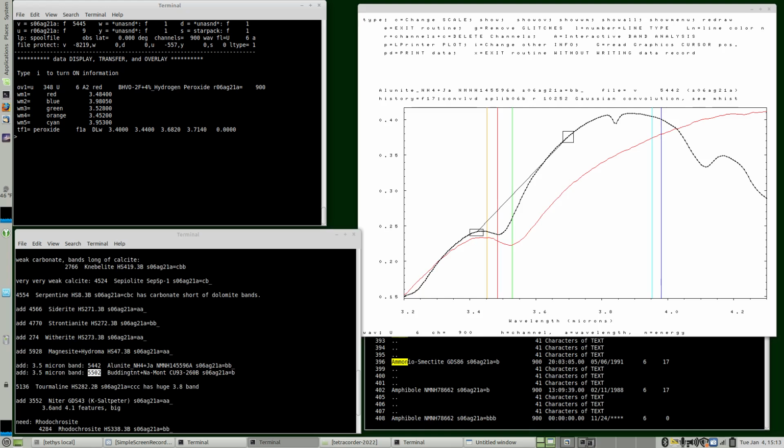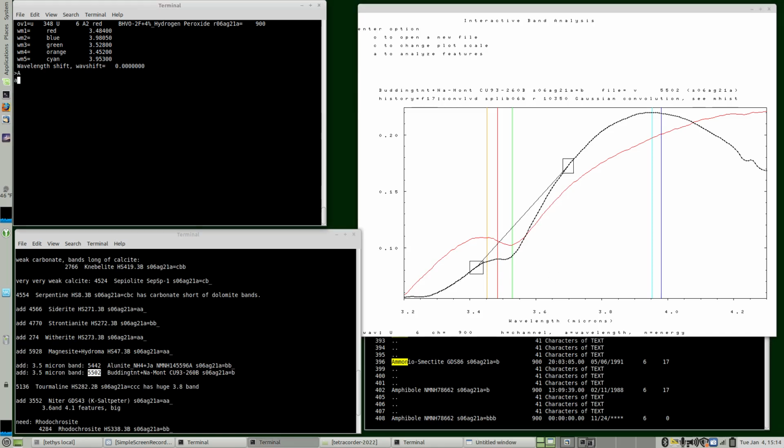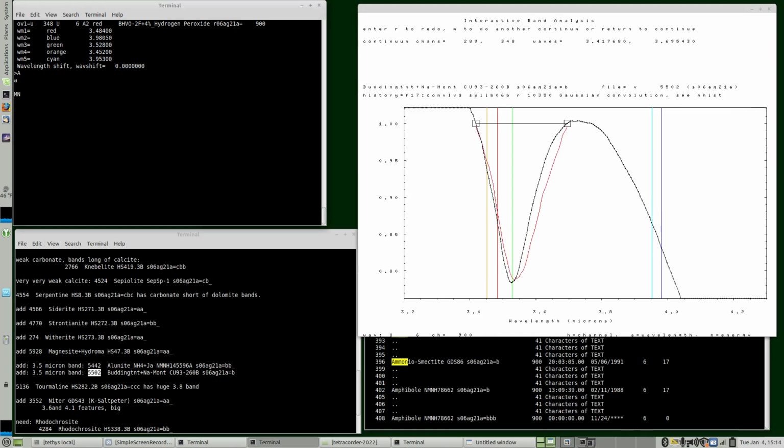And now let's look at this other one. And that has a band that's basically right on. So in a continuum removed feature, and in fact, we can now do that. You see the absorption bands are very close. So let's add this one. So it's buddingtonite. Buddingtonite is an ammonium-bearing feldspar, but it's a proxy. Anything with ammonia in it and an ammonium ion will have similar absorption bands. So this feature isn't necessarily a diagnostic identification of buddingtonite, but a diagnostic identification of an ammonium ion.